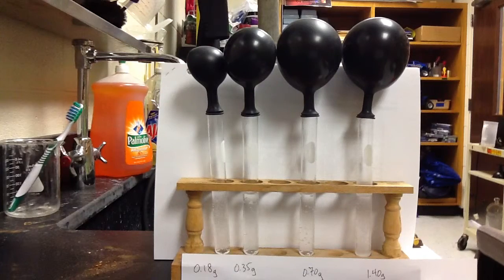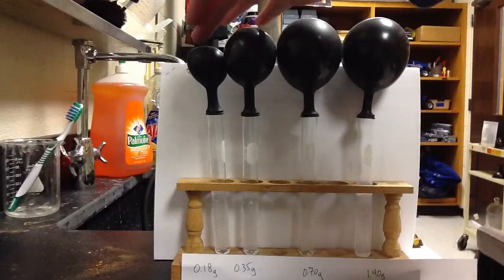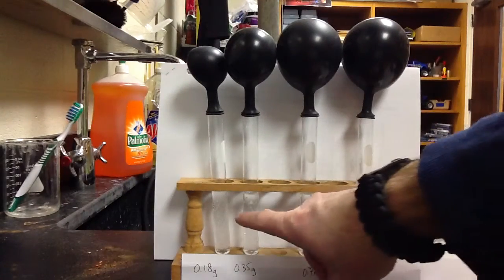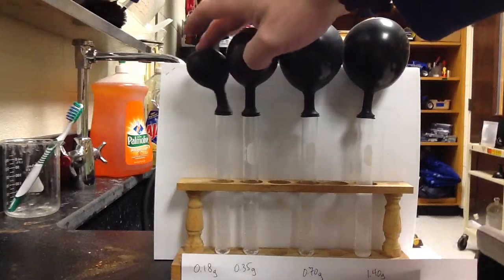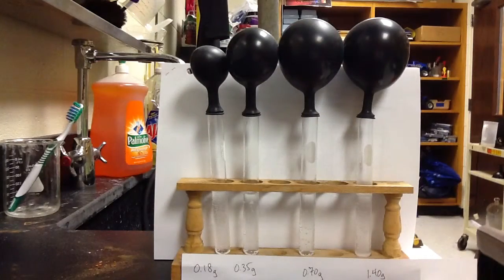Okay, so when we go to test tube 1 here, we can't tell just by looking in this test tube whether you have excess vinegar or not. The vinegar and the aqueous solution that's being produced are clear, colorless liquids. But we could do this in a comparative way. So what we could do is take off this balloon and add more baking soda, and that would tell us if there's excess baking soda, or excess vinegar. Because if there's excess vinegar in test tube 1, then you're going to produce more bubbles.